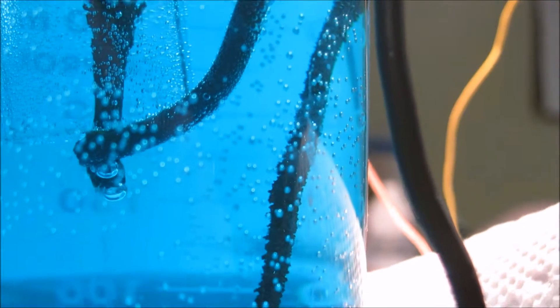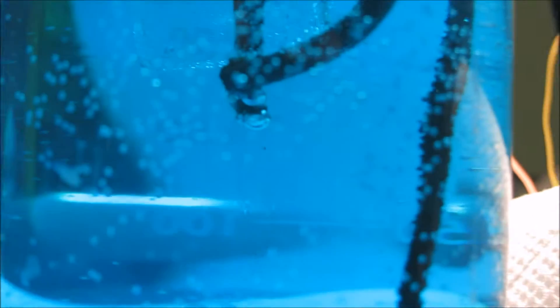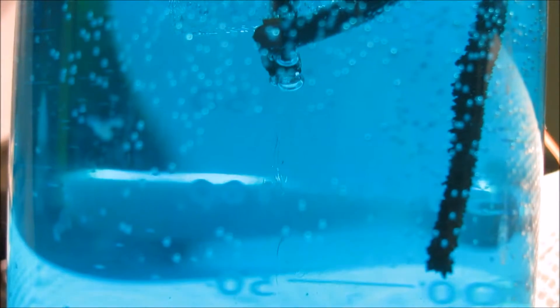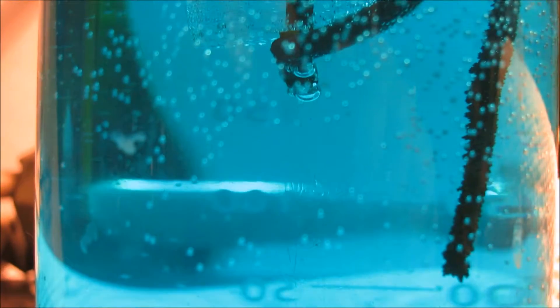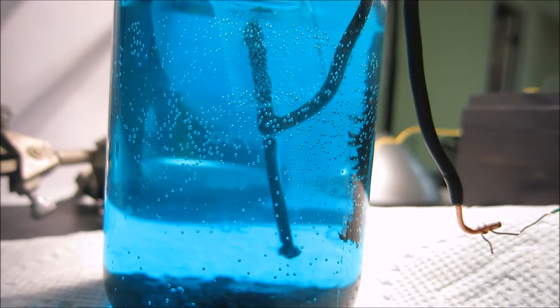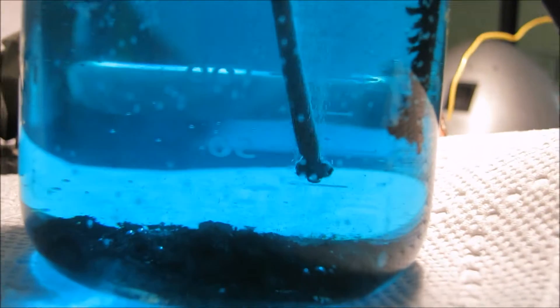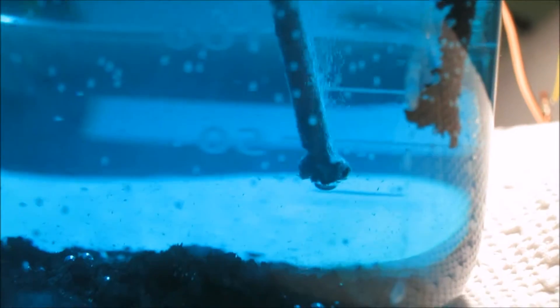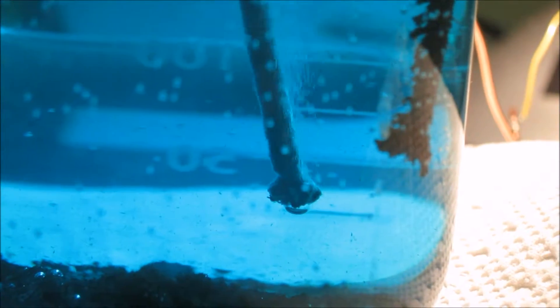You might see it — we have convection on top of the negative electrode, which means that it is heating up. And we have convection below the positive electrode. The nail partially dissolved at the bottom where the contact used to be, and that's why our reaction was slowing down. The nail slid down a bit.